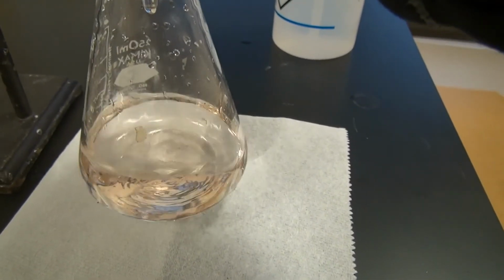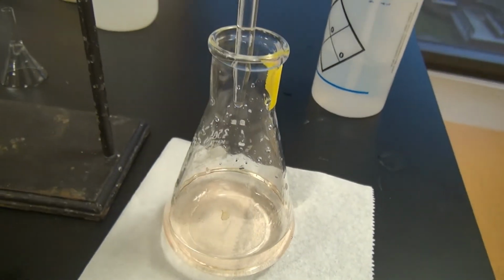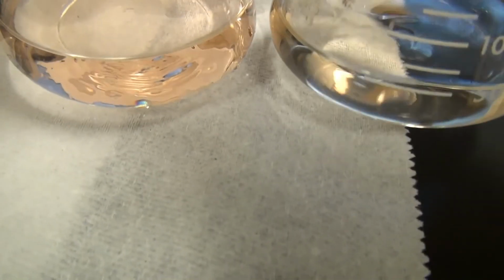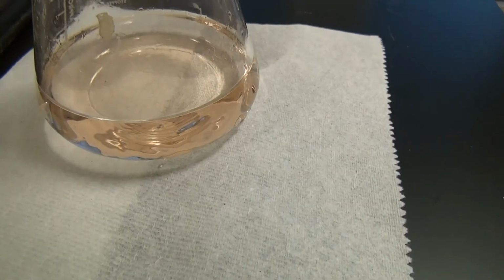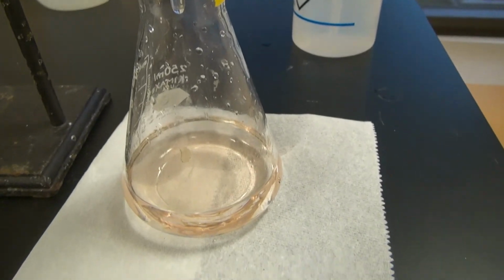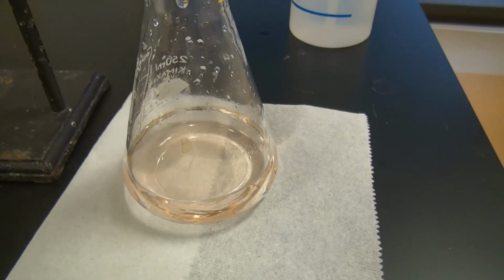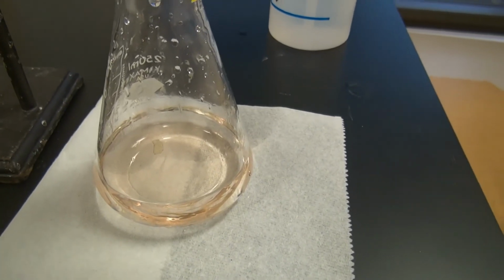Yeah, they're definitely changed there. Okay, put that back to, can you see? Yeah, so I would say that the previous volume before this last drop right here would be the equivalence point volume that I'm going to use. Okay.